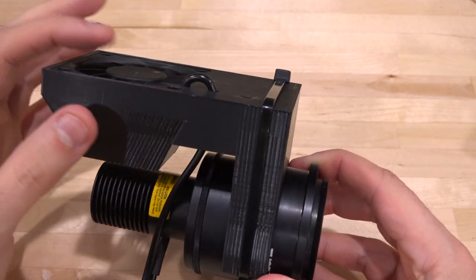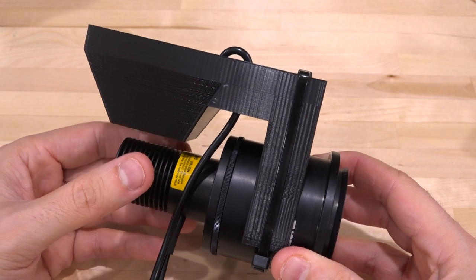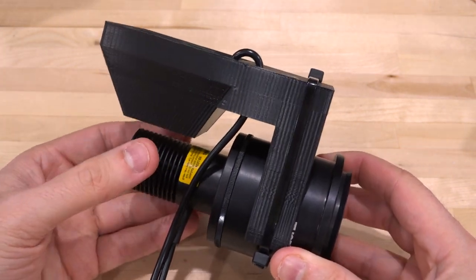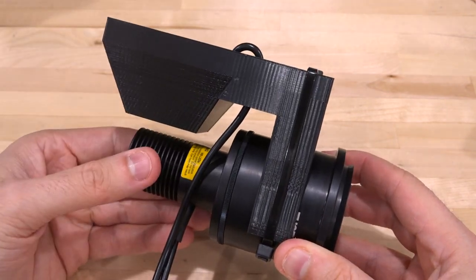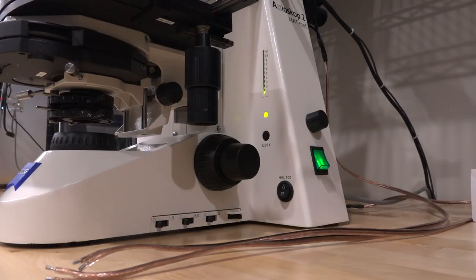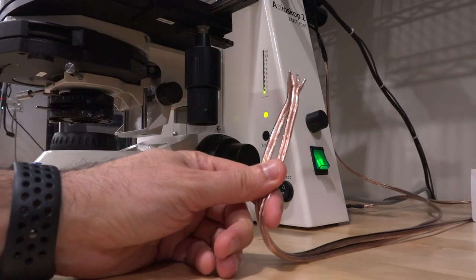And at the same time, this fan and this LED have roughly the same voltage. So the voltage across the LED is reasonably constant. It has an exponential IV characteristic. So this thing just basically spins as soon as the LED turns on, and it keeps it at a very nice temperature. So I installed the two lights into the microscope, and here are the two cables that come from them.